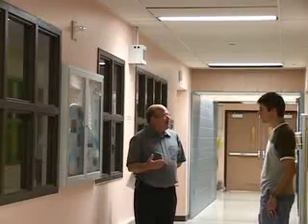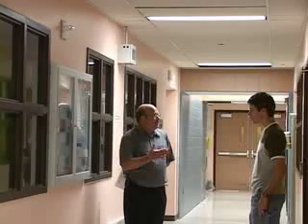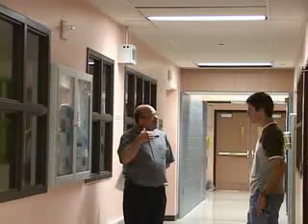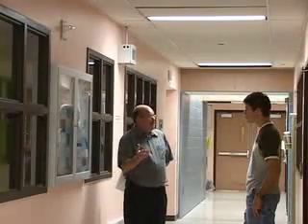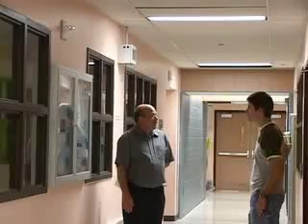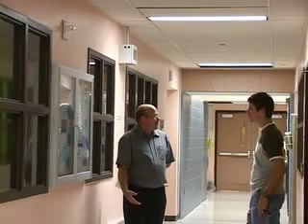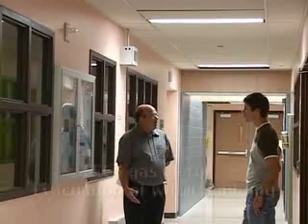All right, but what will happen is that at half TLV, we will evacuate. You'll start to leave the lab, and you'll realize the building hasn't dumped. What occurs is at full TLV, it actually generates a signal for us to dump. We want everybody out of the building. And that's when we employ the fire alarm. At full TLV, the fire alarm and the annunciation will be related to whether it's a fire or a toxic gas.